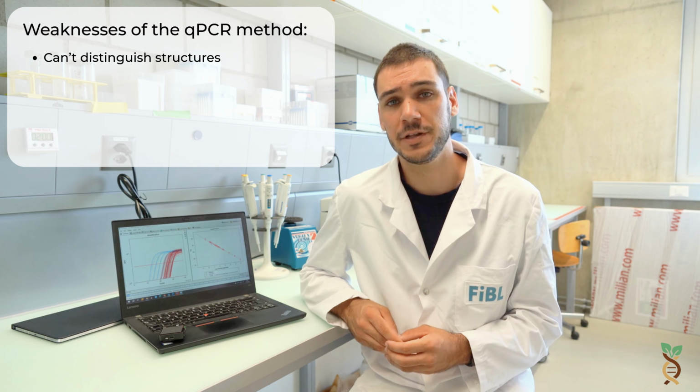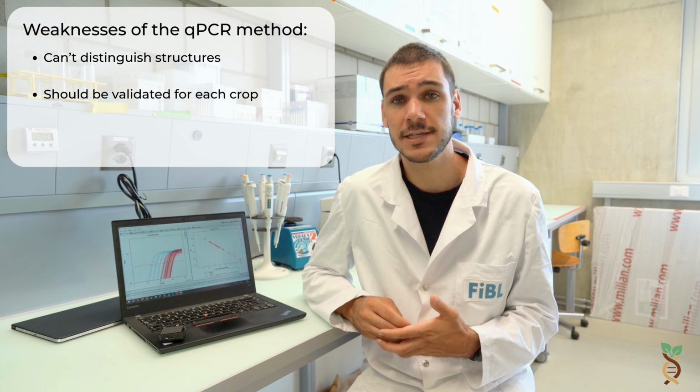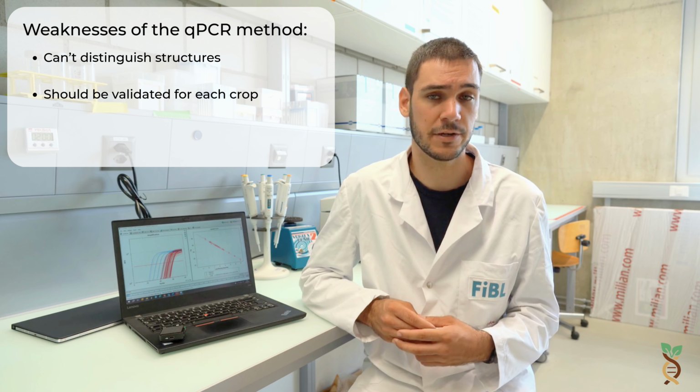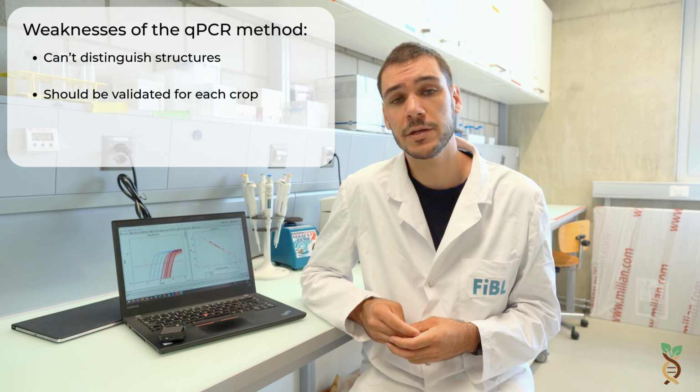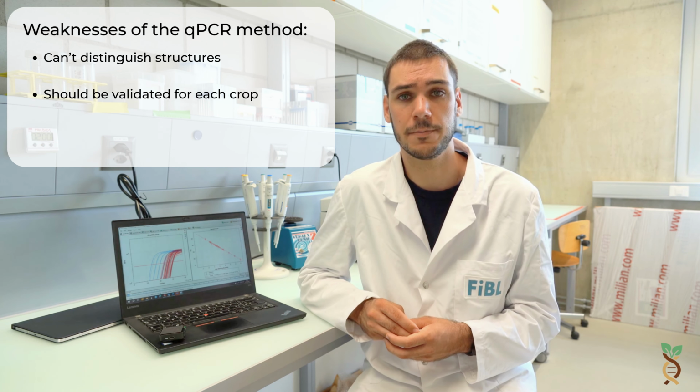One weakness of this method is that it cannot differentiate between the different AMF structures, as happened with the microscopy. In addition to this, it has been reported that this method yielded inconclusive results for specific crops. Therefore, we recommend you to validate this qPCR approach for your specific crop.